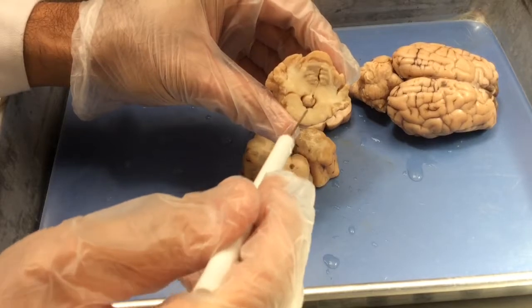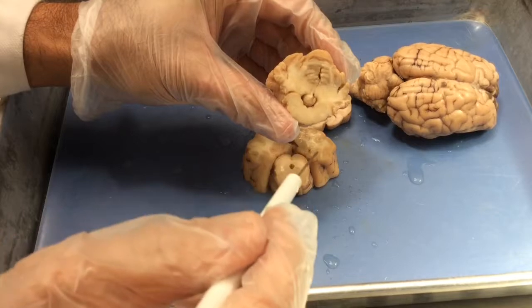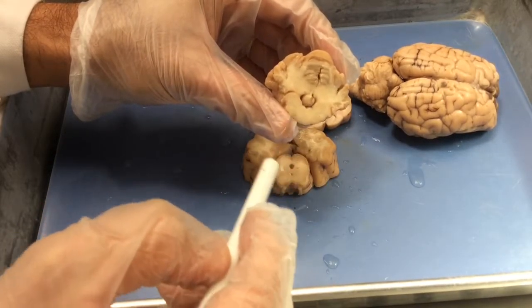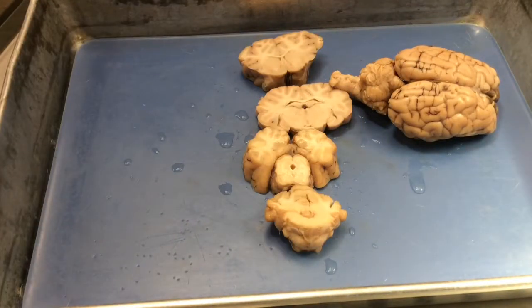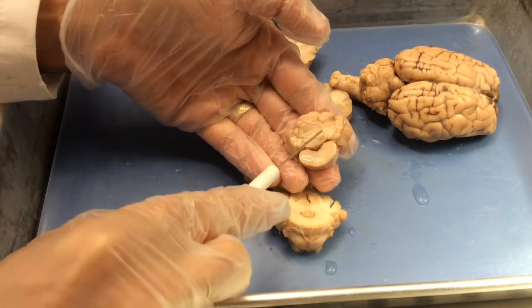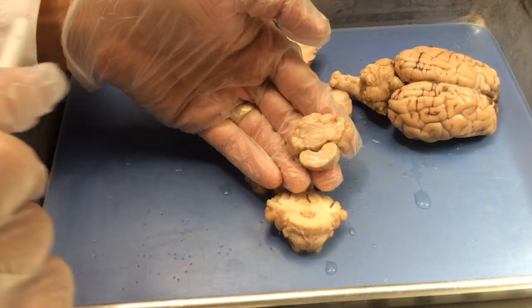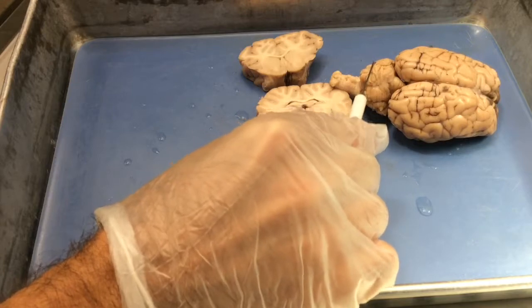The space in between the cerebellum and the pons is another ventricle. It's called the fourth ventricle. So there's not much to see here other than cerebellum, fourth ventricle, and what is probably the pons, although it could be the beginning of the medulla. As you go further back, cerebellum gets smaller and the brainstem gets smaller. Again, you still have fourth ventricle in between the cerebellum and what is now the medulla, or medulla oblongata. We're back in the very back part of the cerebellum now.